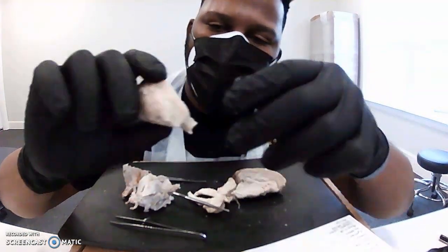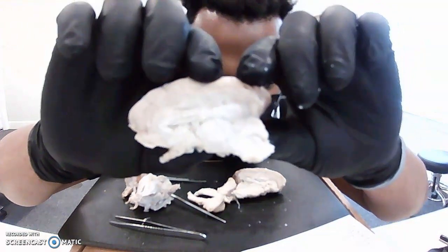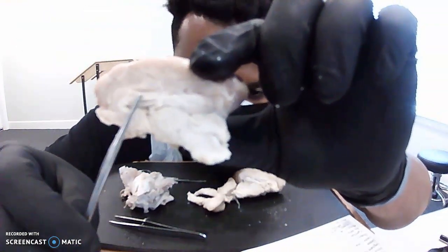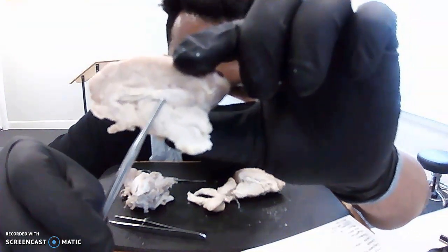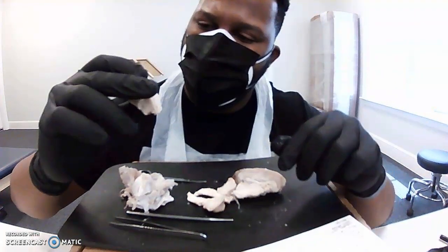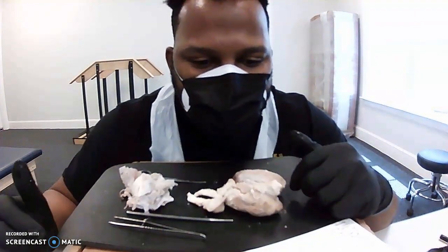Like I said, it's kind of hard to see. Maybe it's just the brightness of it. Maybe if I did it like that, you could see a little bit better. But I can't see it well. Corpus callosum. Anyhow, I think I hit all the things. Hopefully that's good. Okay, thank you.